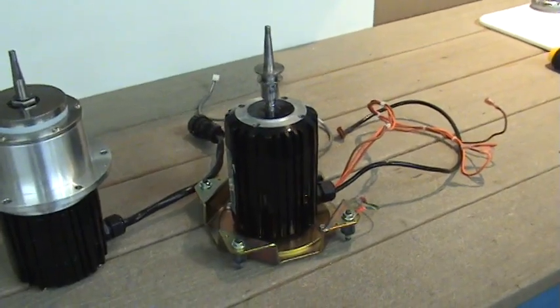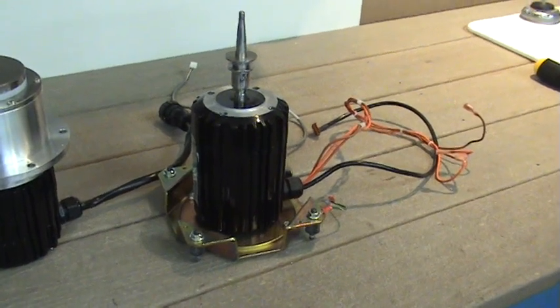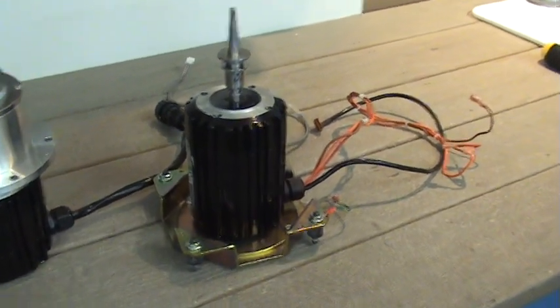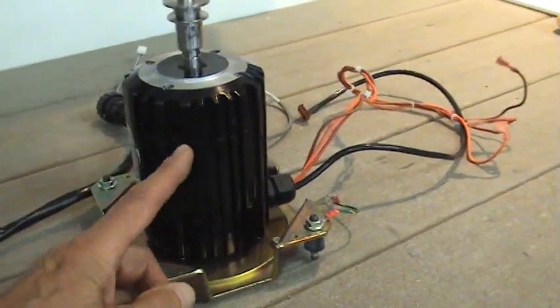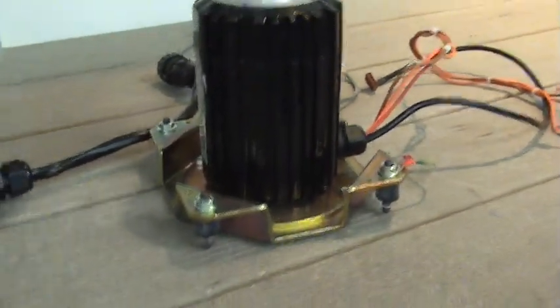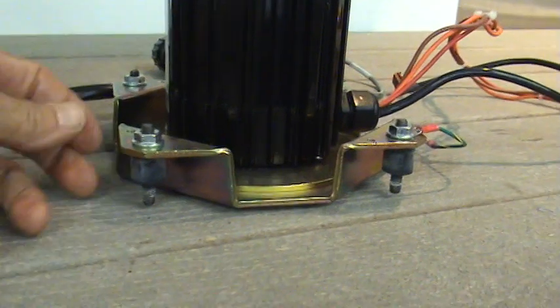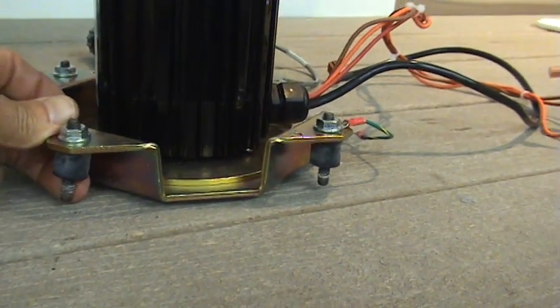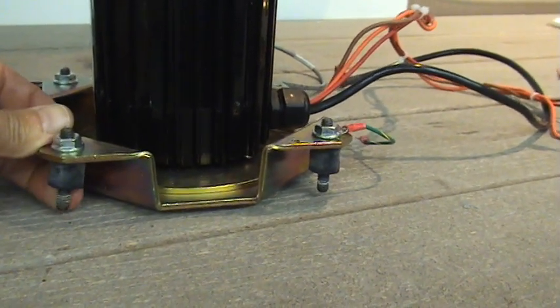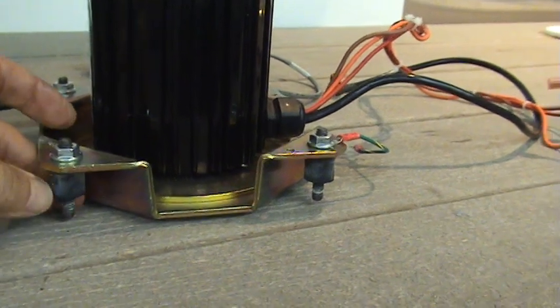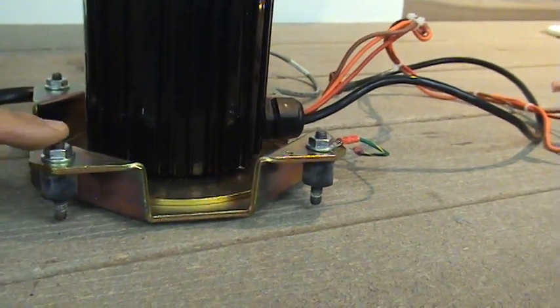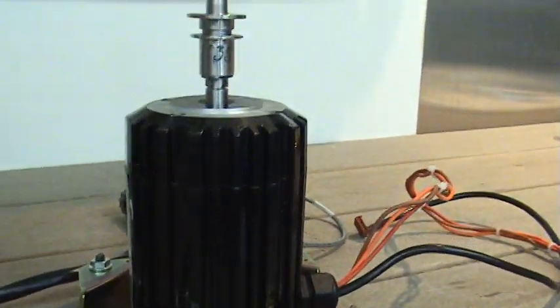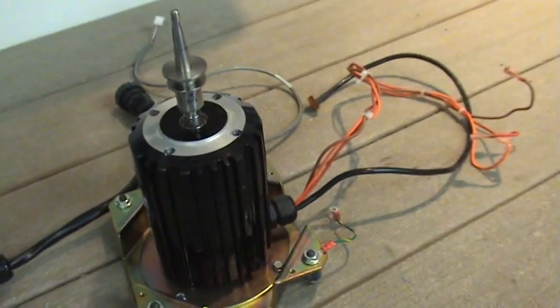This is a view of the drive mechanism from the centrifuge you just saw. It consists of a motor here and then this mounting system which basically uses rubber donuts. These mount hard to the chassis and the rest of the motor is suspended through this rubber piece and allows the entire motor and rotor to shift.